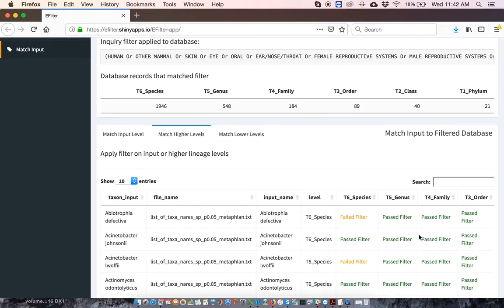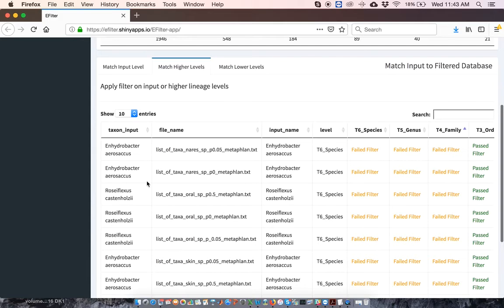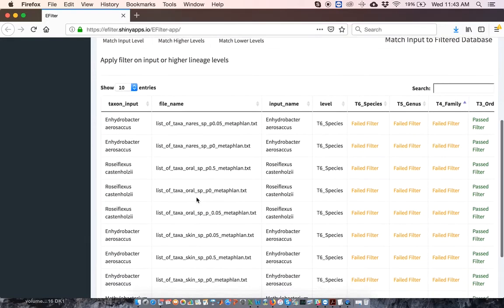For large systems or multiple inputted files, this table will be very large, but you can quickly navigate the table by sorting each column. So for instance, if I want to know where the egregious failures are, I can sort by a high taxonomic rank, for example, family. These particular taxa are ones that I want to examine carefully since they represent highly likely issues with sequencing or bioinformatics pipelines.